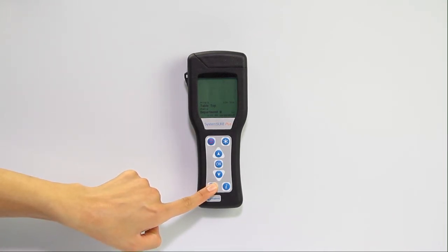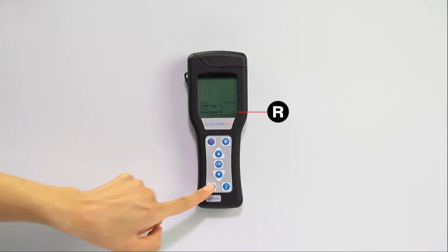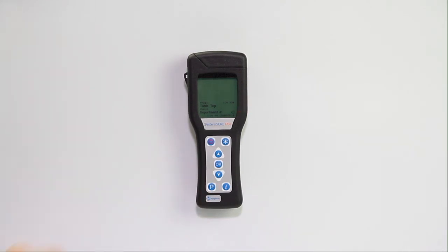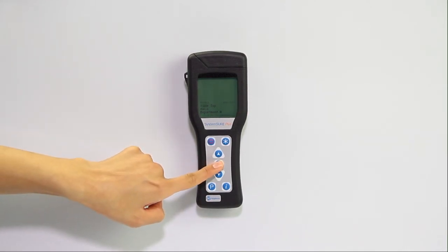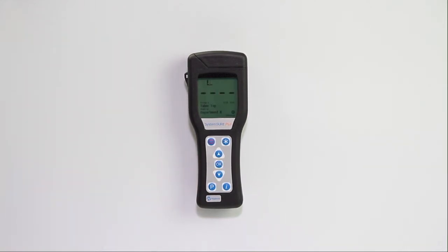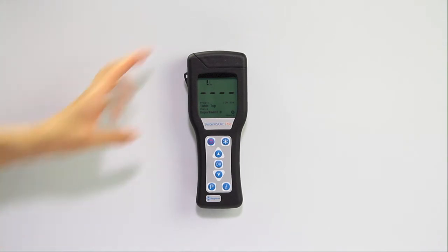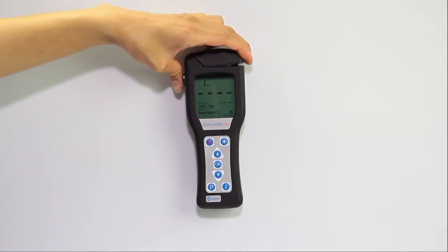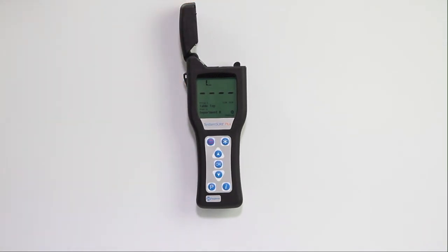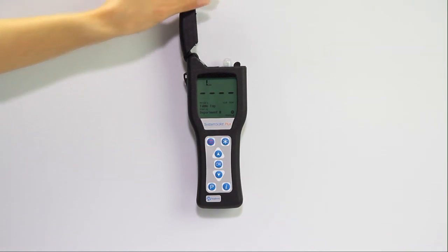Press the P button until you see an R flashing on the screen. Press OK to enter the test ready screen. Swab the area, insert the device in the meter, then select OK to run a test.